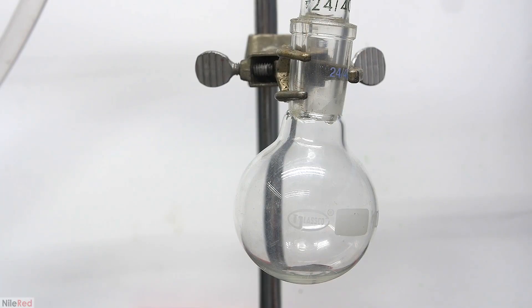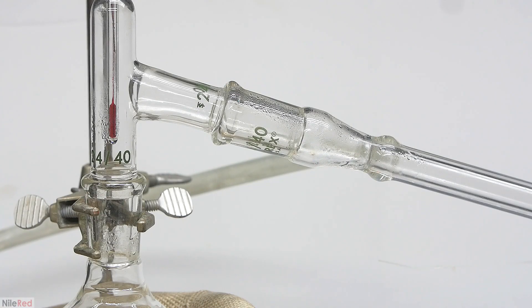If we remove the vacuum and expose the system to air, we're gonna get a lot of benzoic acid forming. I honestly tried to get away with doing it in a previous run, but let me just say, it does not work. I ended up introducing a whole bunch of benzoic acid into my final distillate, and this defeats the entire purpose of the whole cleaning procedure.